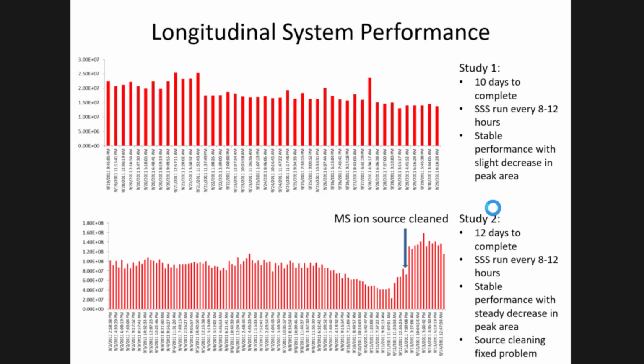So these are two examples of the longitudinal system performance where we're looking at one peptide, and this is longitudinally from September 19th to September 29th, so over 10 days, looking at the absolute peak area of one of our standards. The system suitability was run every 8 to 12 hours, so 2 to 3 times a day, and this looks pretty good. When we looked at another system that had it run from September 2nd to September 14th, a little bit longer period of time, we noticed stable, stable, stable, and then this gradual decrease.